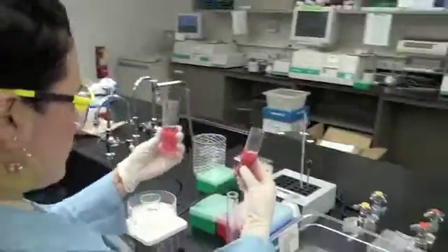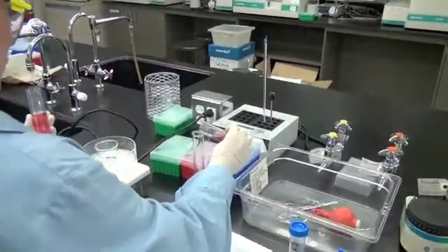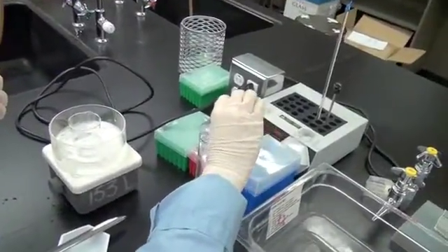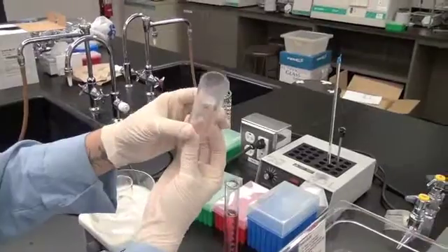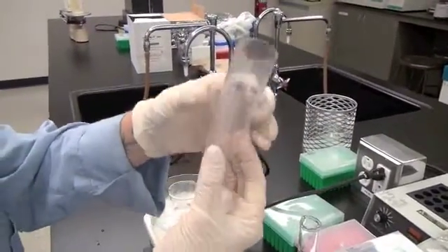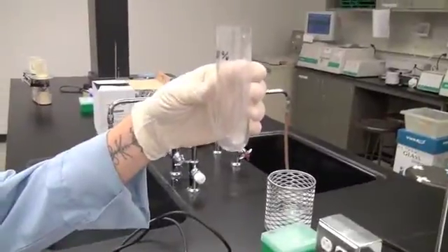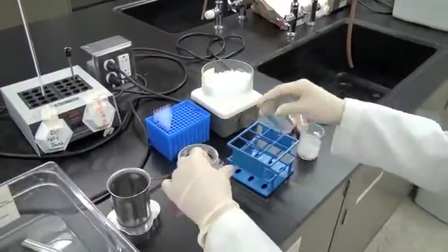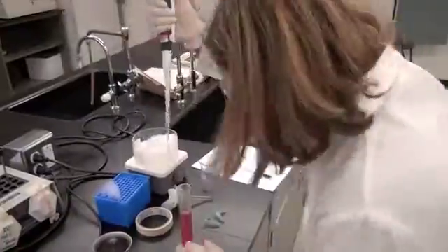We are back, and Biochemist Dicer has her 40% supernatant. She carefully inspects the size of the pellets. A careful scientist will estimate the approximate mass of the pellet. Qualitatively, this one looks like it's about the size of a 200 milligram tablet squished to the side of the tube. Challenger Kurate has also completed her second spin and is measuring and aliquoting her test sample.